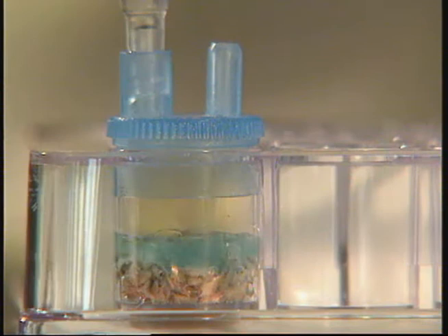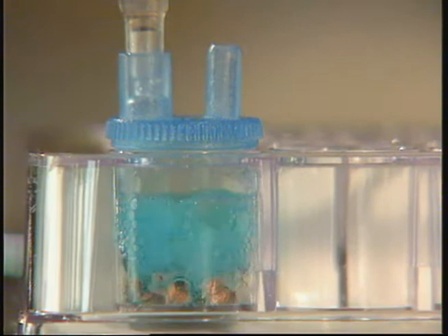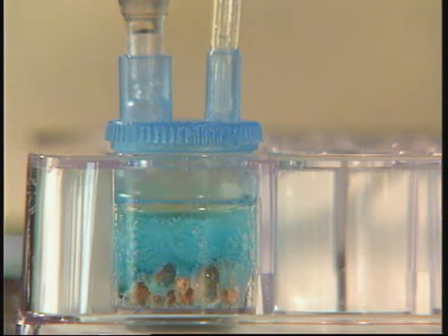Note that a blue solution begins to form in the well. When a brown gas begins to form above the blue solution in the well, squeeze all the air out of the bulb of a propette and insert the stem of the propette into the vent in lid 1.